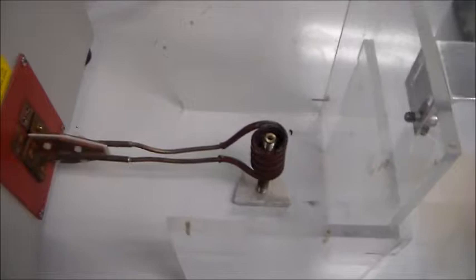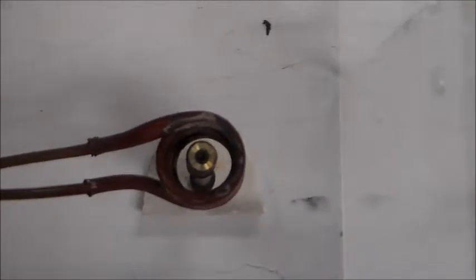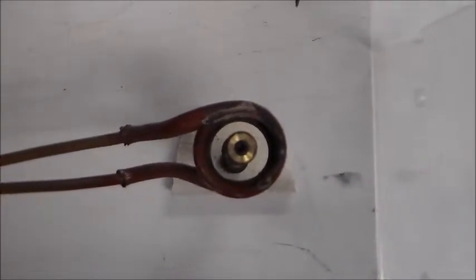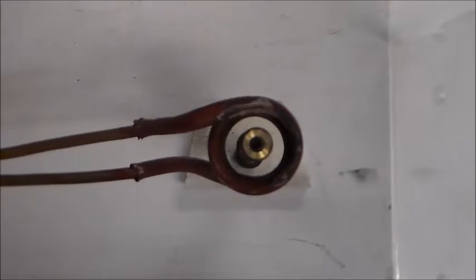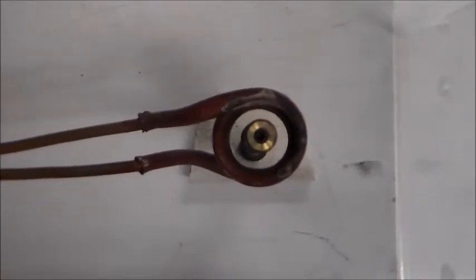The third step is to make sure that the sample that you're going to heat is set right at the center of the heating coil. It is important to make sure that it is centered since this will guarantee the uniform heating of the sample.